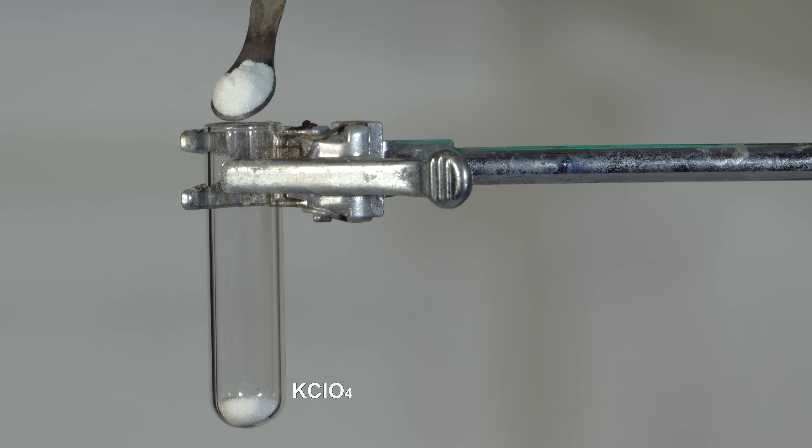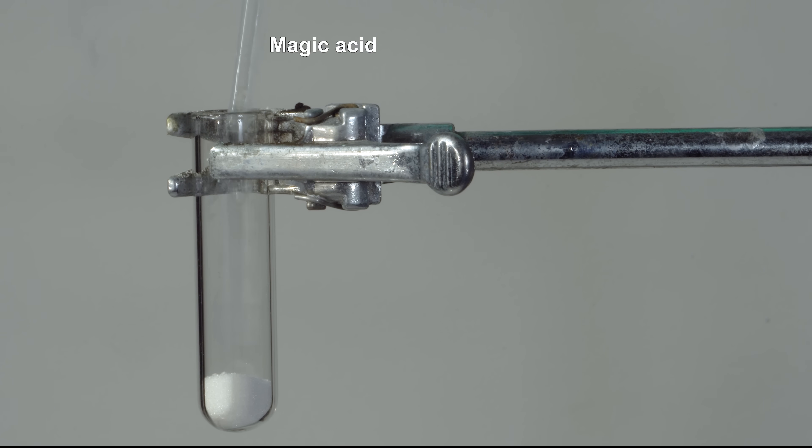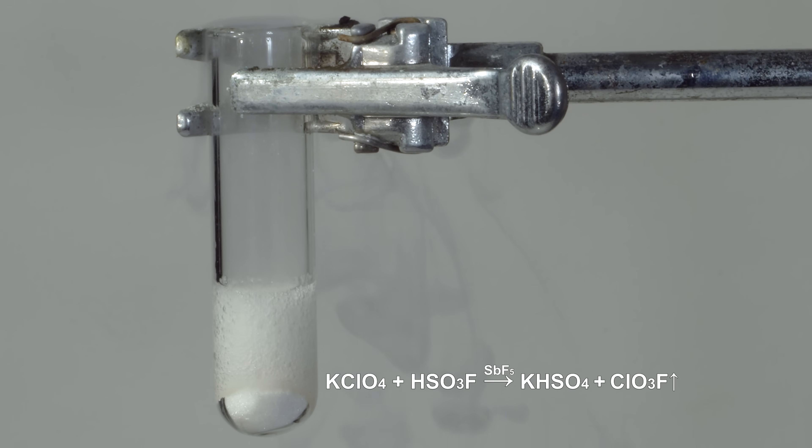A peculiar one is the reaction between potassium perchlorate and magic acid. Mixing these two reagents, you can see active gas formation. This gas is no other than perchloryl fluoride. It is toxic and is a powerful oxidizing and fluorinating agent.